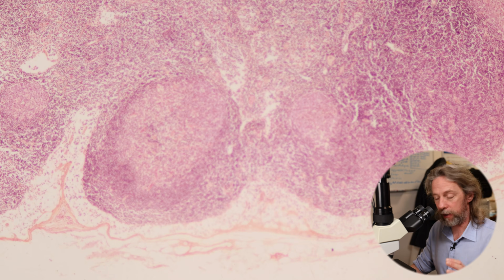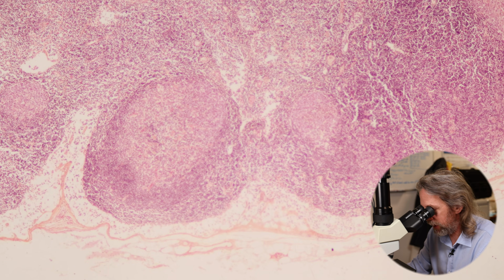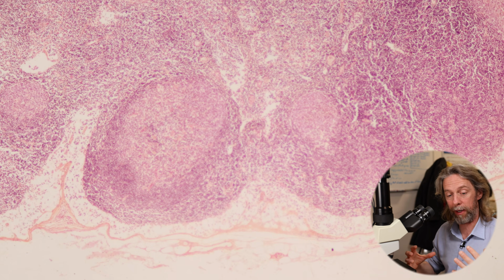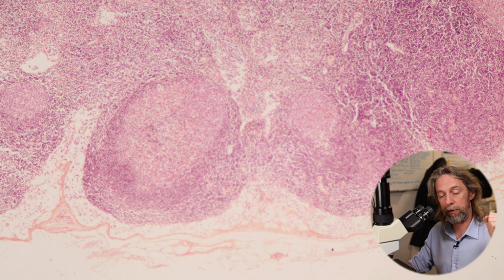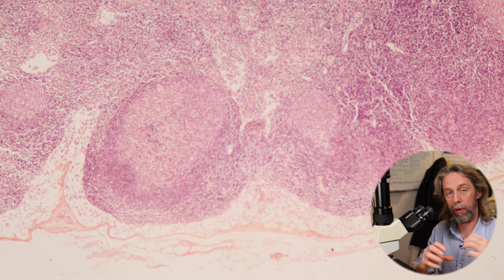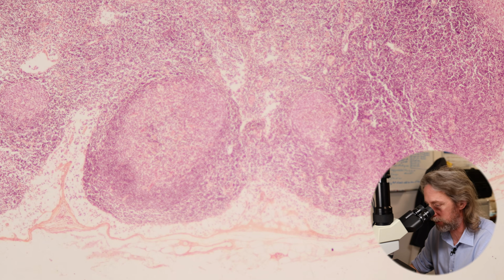But I just wanted to point out that I said that metastatic cancer cells can move in here and move into that subcapsular sinus, and I said that in a normal immune response the cells here can proliferate and the lymph node can enlarge. But if these B lymphocytes here were to proliferate in an uncontrolled manner, if they were to become a tumour, that would be a lymphoma. So the B lymphocytes in the lymph node itself, if they lost control of the regulation of their proliferation and started to form a tumour, that would be a lymphoma, which would be a cancer.